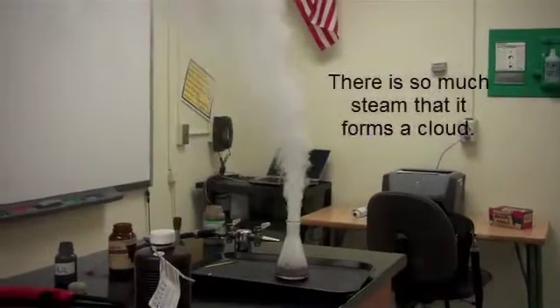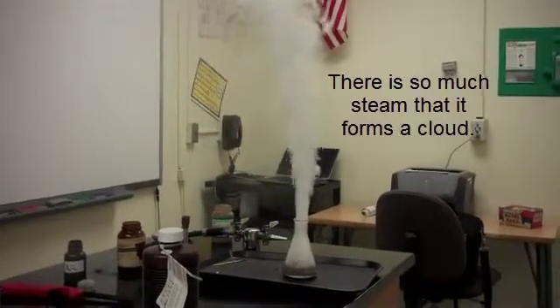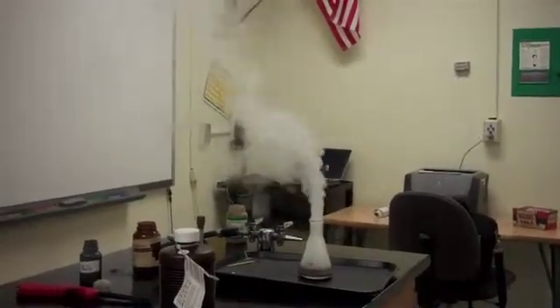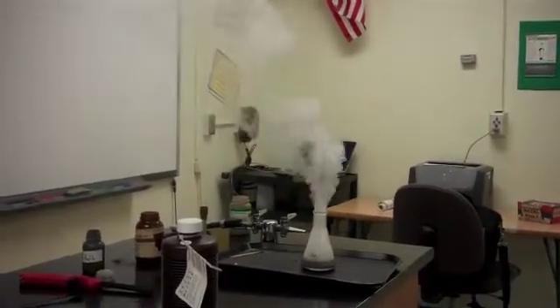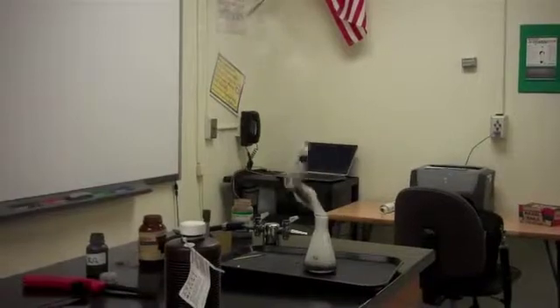It's a lot faster, isn't it? What you're seeing, the white smoke is not smoke at all. It's water vapor. It's a lot of water vapor, though, so it's condensing. The water droplets are condensing into micro droplets, and that's what you're seeing.